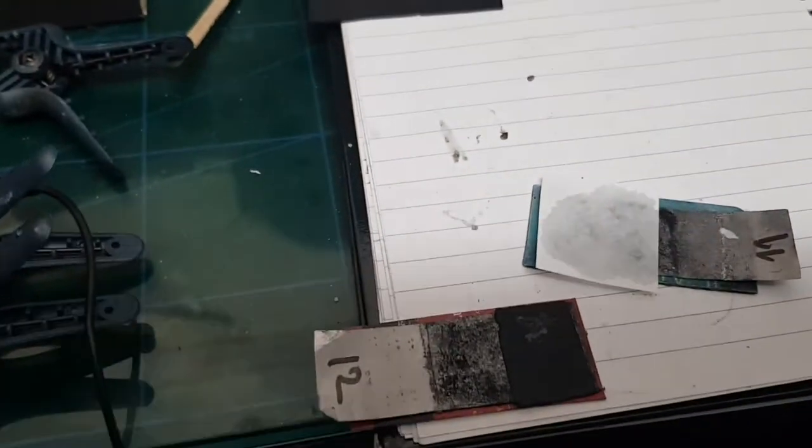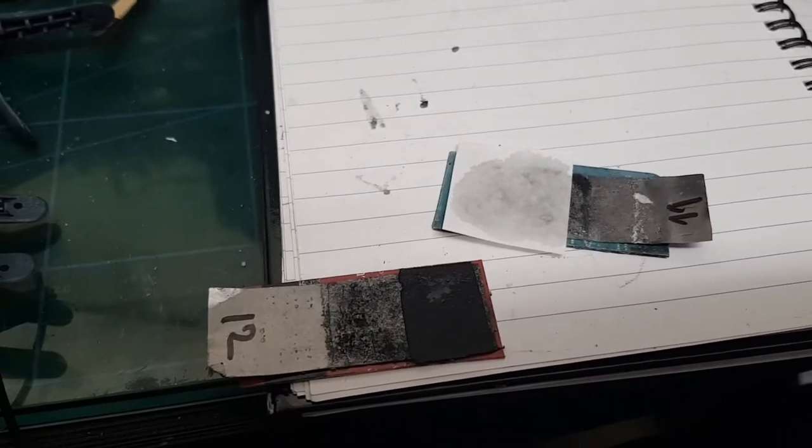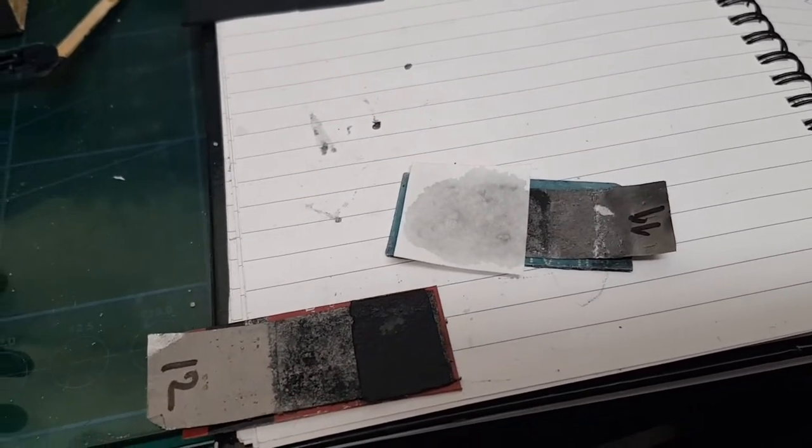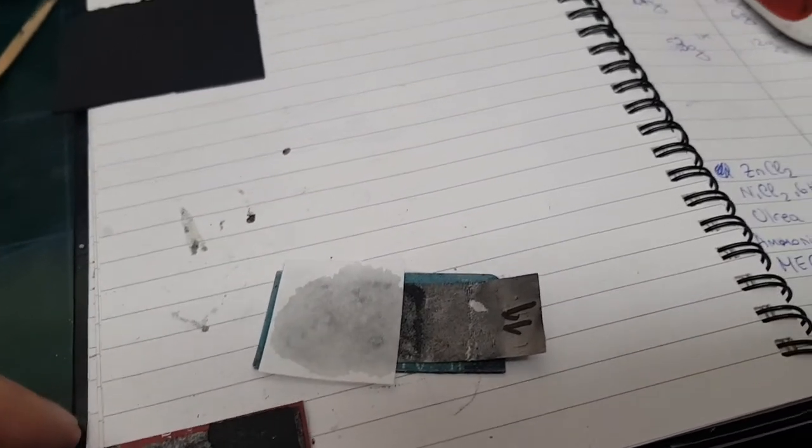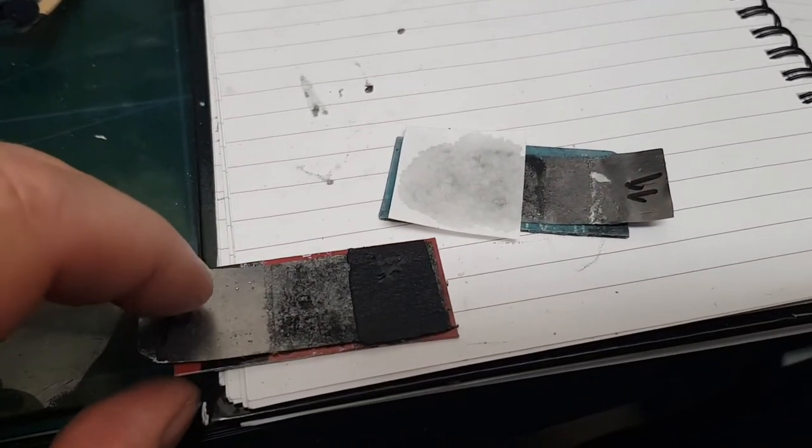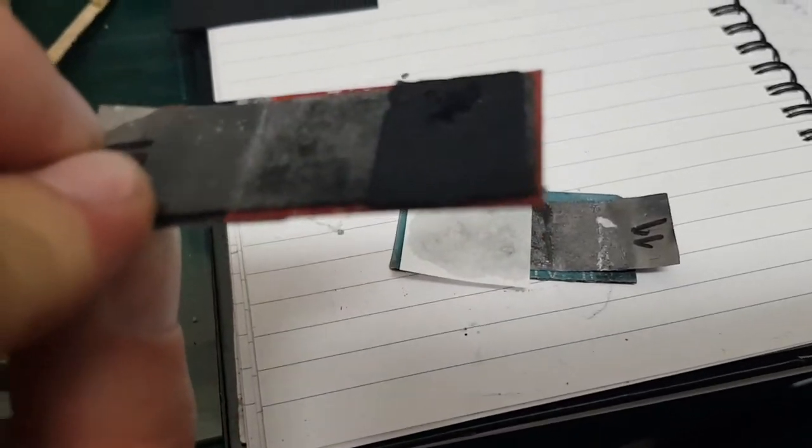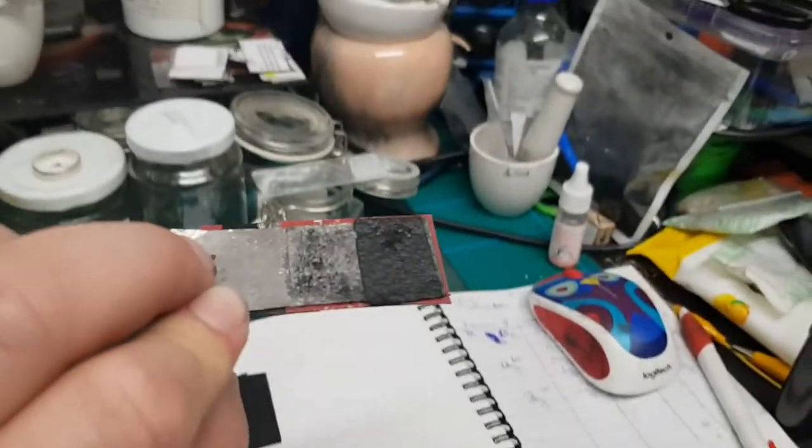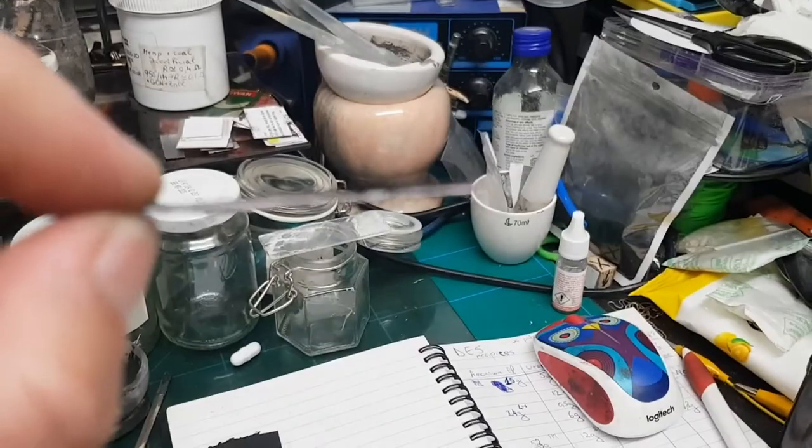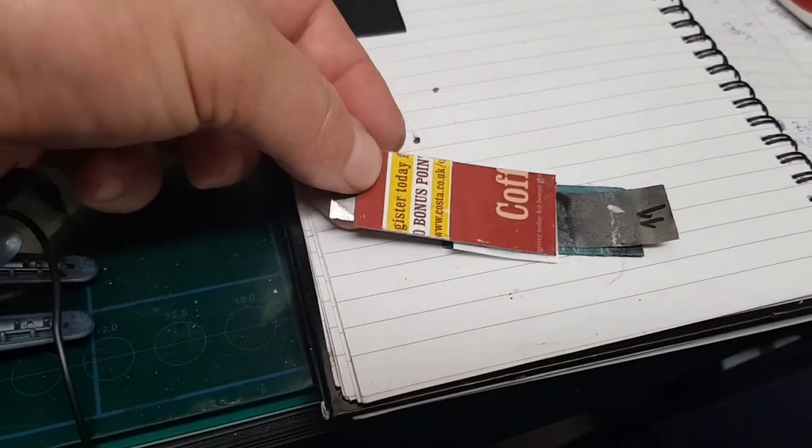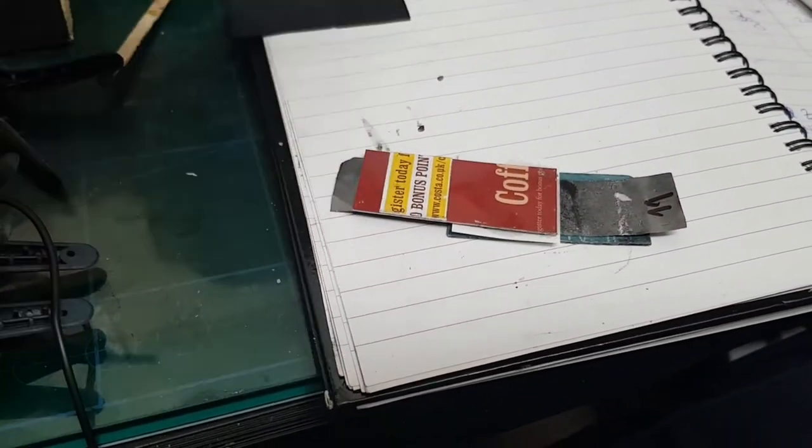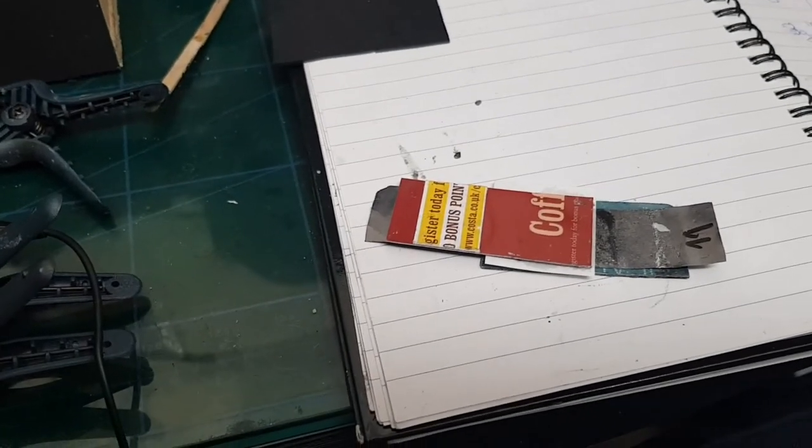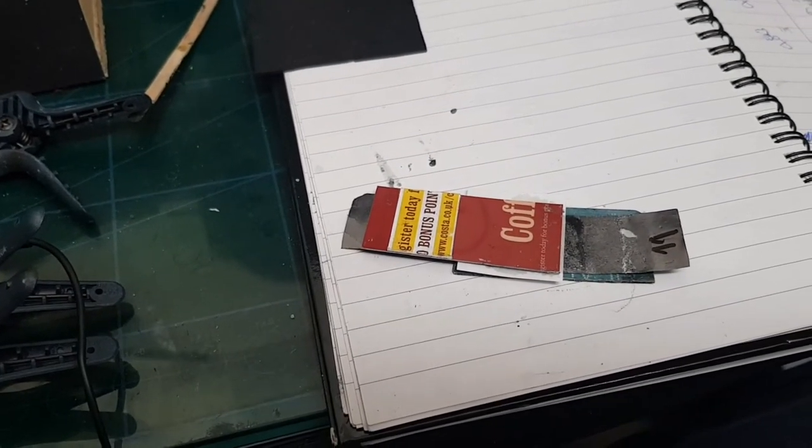This is the second device I'm going to test with the deep eutectic solvent based on ammonium chloride and urea as electrolyte. These electrodes are really thin. I'll show you exactly the piece that I used to make these electrodes.